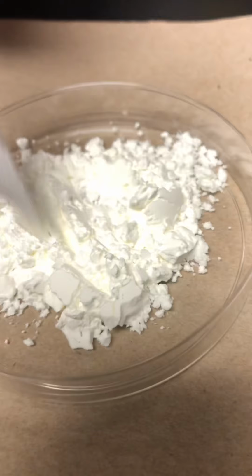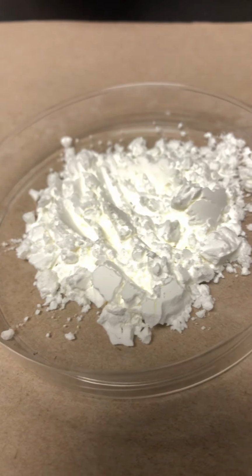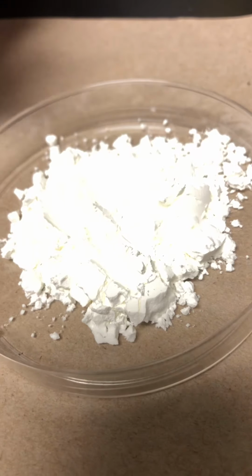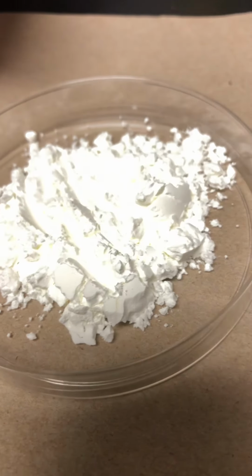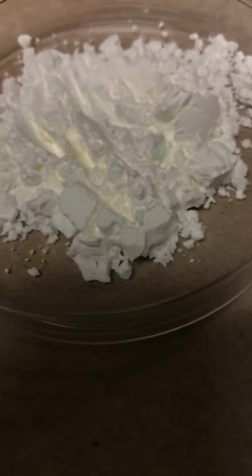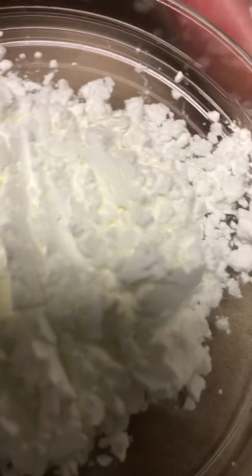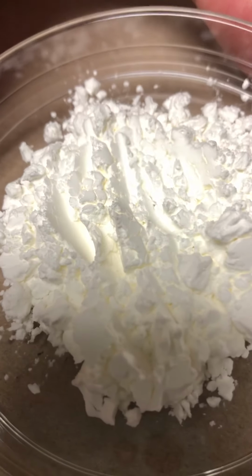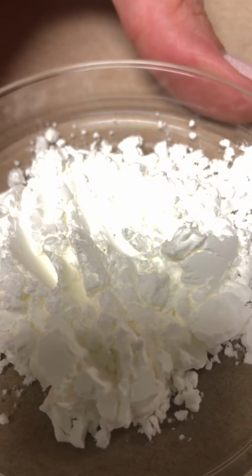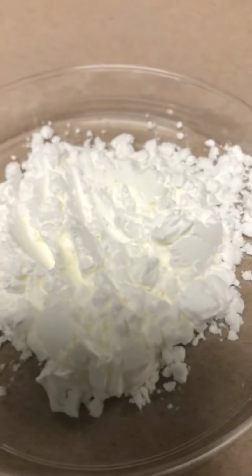Have you ever played with cornstarch before? It is super soft. If you move your fingers, it gets kind of gritty, almost real smooth. Cornstarch is used in lots of different things, sometimes even in lotions, so it makes your skin really smooth. So make your observation of what it looks like. Those are physical properties. You can say it's white, that it's a solid. Okay. All right, now let's test some chemical properties.